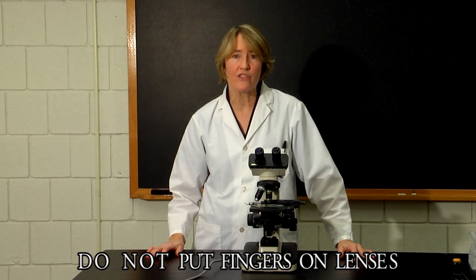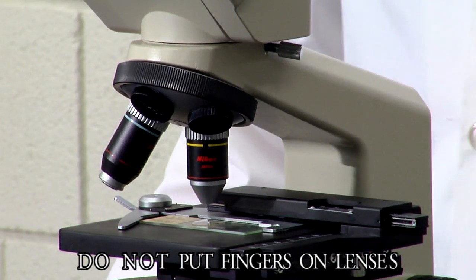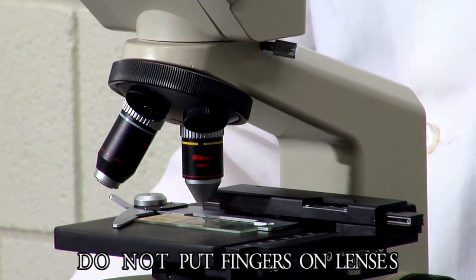While you're working with your samples and focusing, you want to make sure that you don't put your fingers on the lenses, because they're very delicate and they're hard to clean.